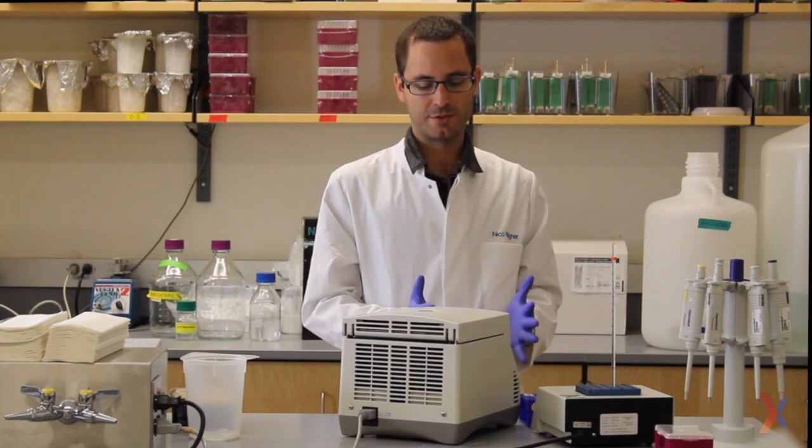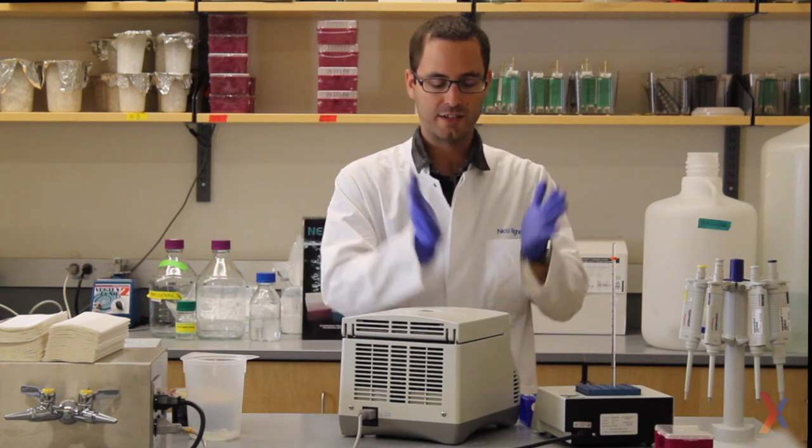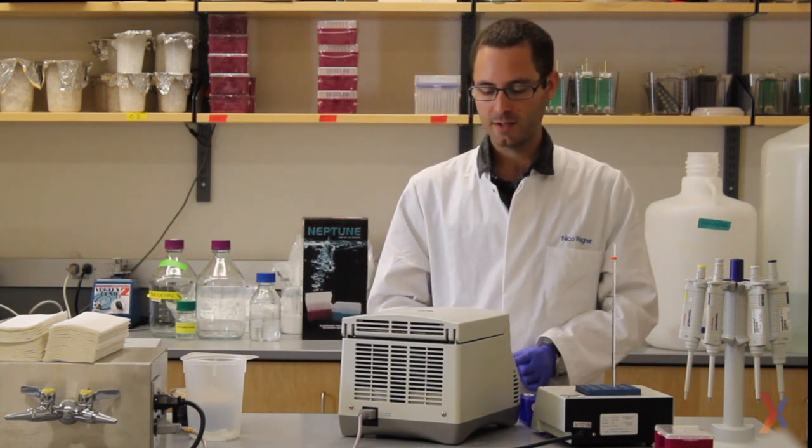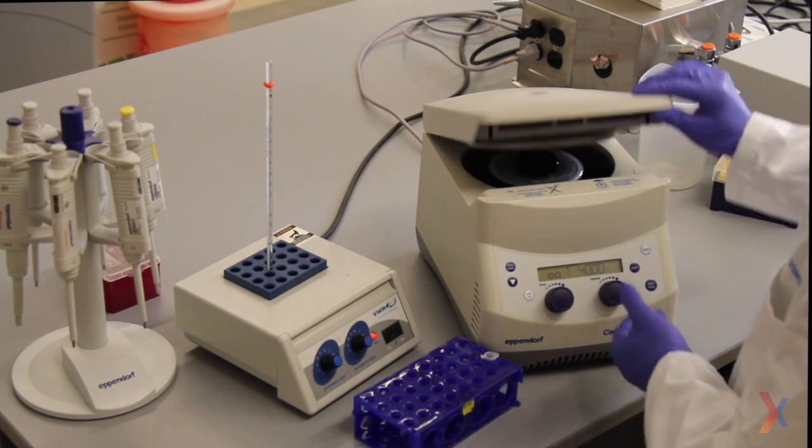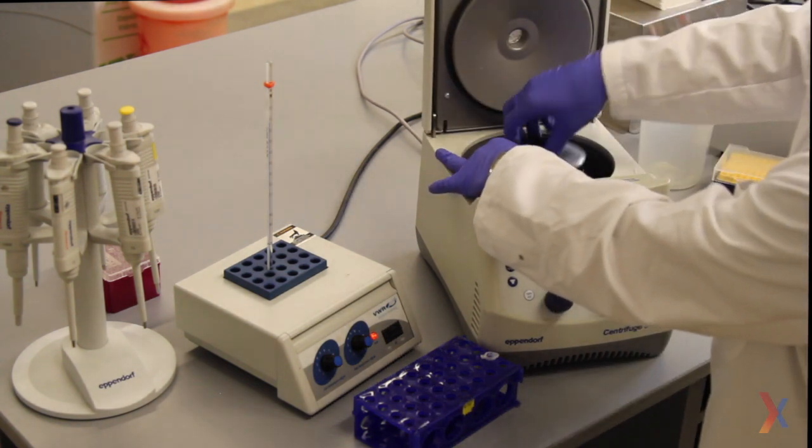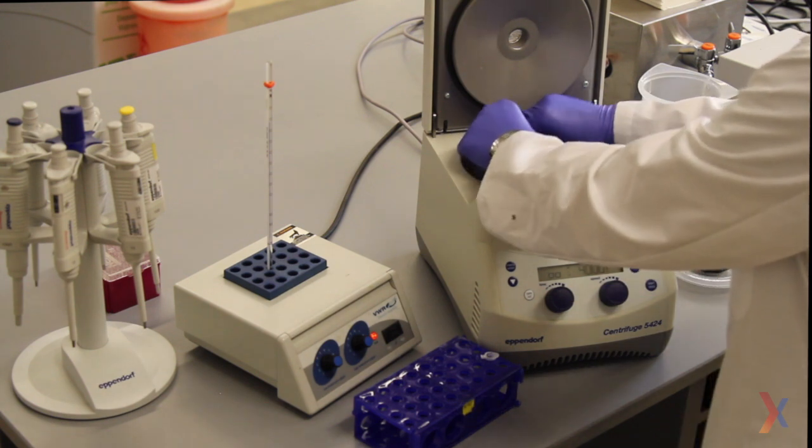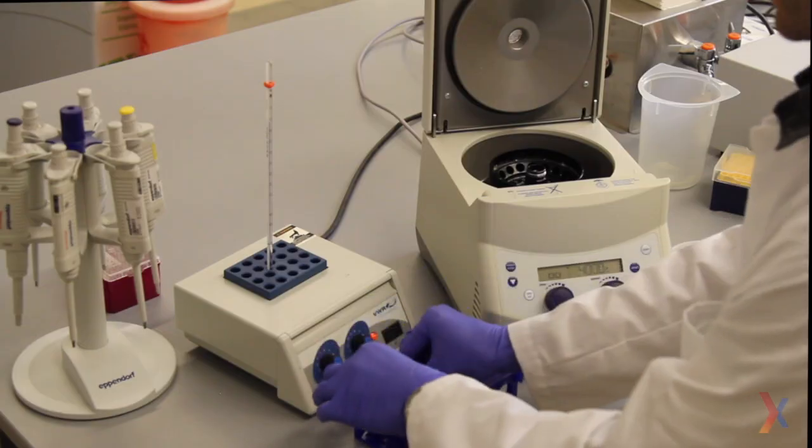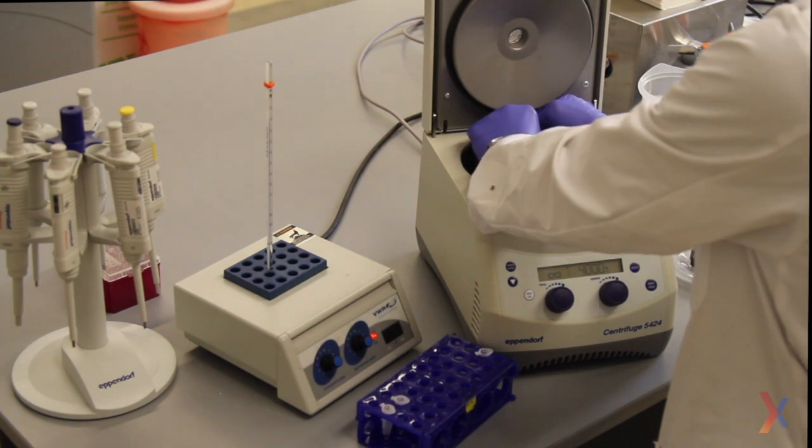As I mentioned, this helps make sure that all of the sample gets to the bottom of the tube. For example, if anything has been stuck to the lid or the sides, it is now pulled back to the bottom, and we have exactly the amount of sample that we would like for the gel. Quick check and now they're ready to be loaded onto a protein gel.